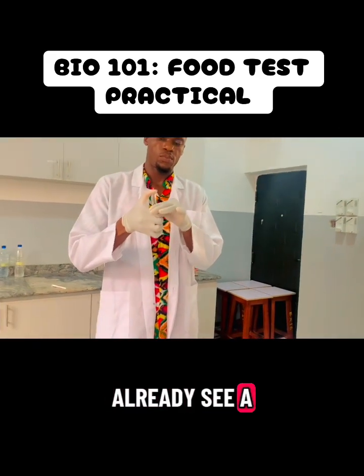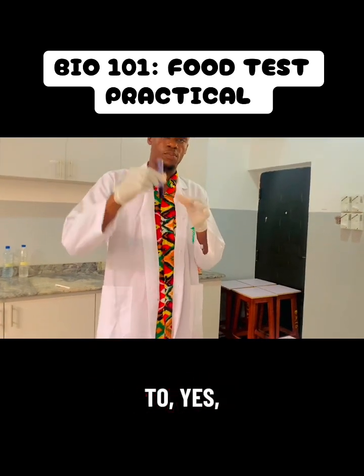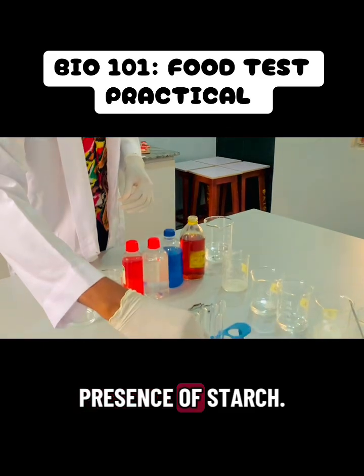You can already see a change in color. I have to shake a bit, and yes, that is it. A blue-black color indicates the presence of starch.